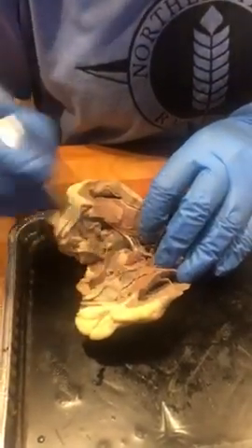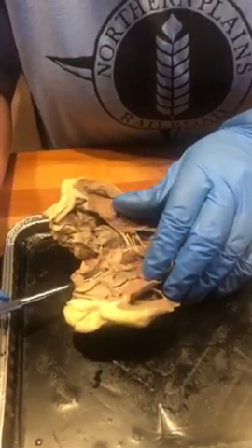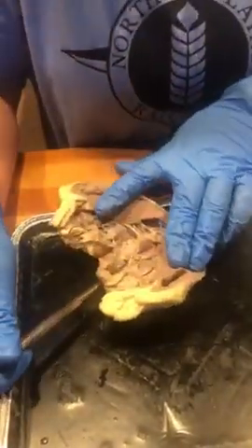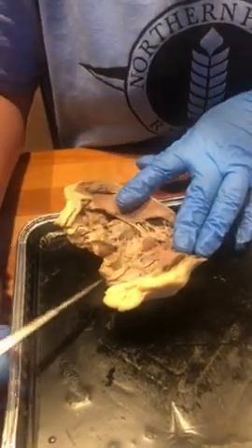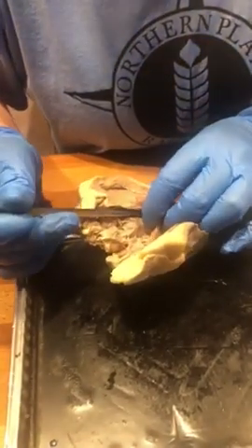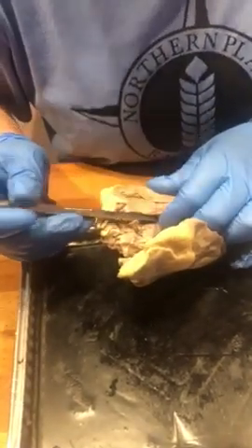And our pulmonary artery goes to our lung to get the blood oxygenated. And then once the blood is oxygenated, it returns to the heart through the pulmonary veins, which is right here. We know that because when you close it, it comes right there. So from our pulmonary vein, it returns to the heart, and then it goes into the left atrium, and then it goes to the left ventricle, which is separated by the bicuspid valve, which again prevents backflow from the left ventricle.